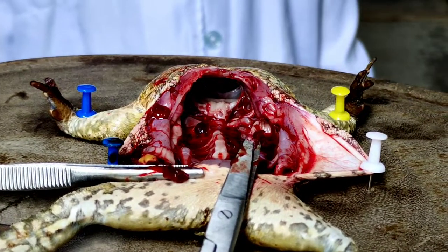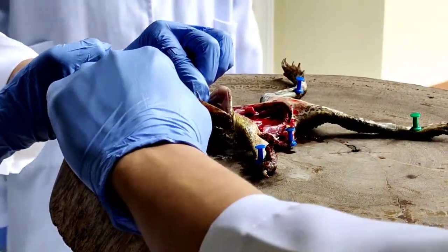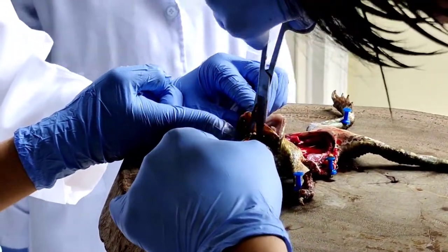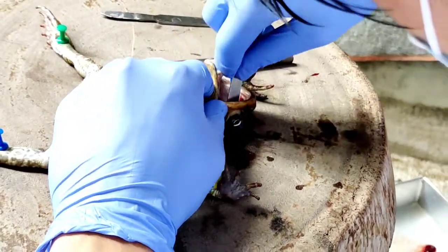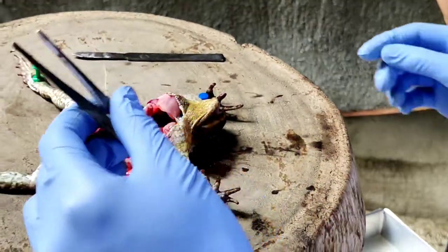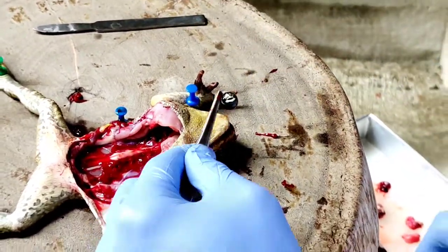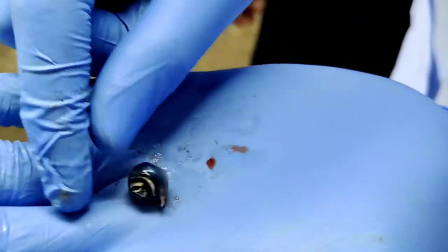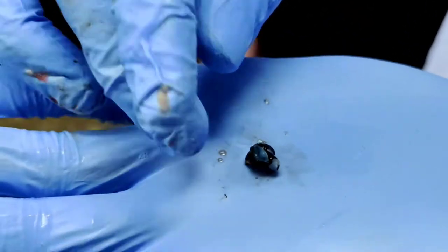This is what the frog looks like without all of the internal organs. Next up, we extracted the frog's two eyeballs. We then exposed them both to the sunlight. We removed some parts of one eyeball so that we could see the vitreous body.